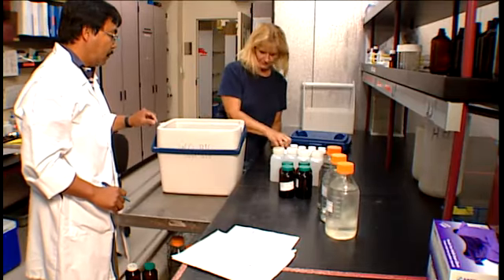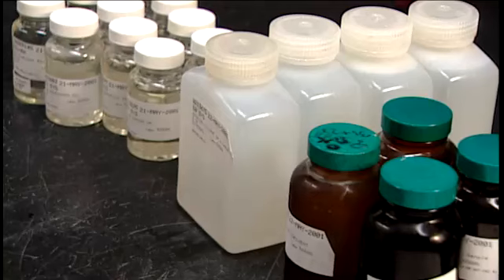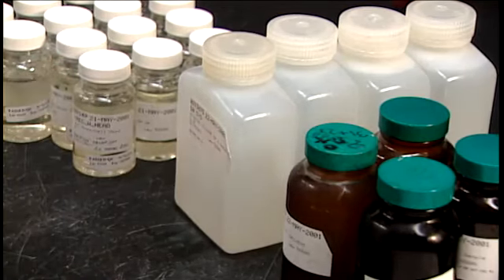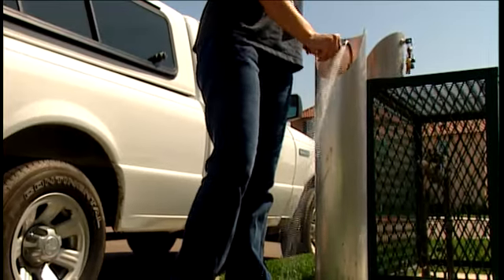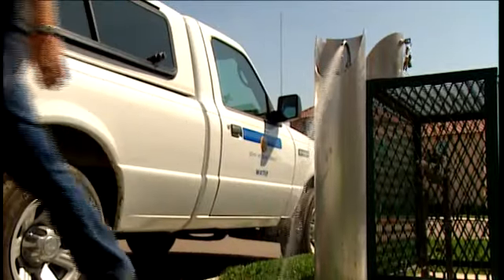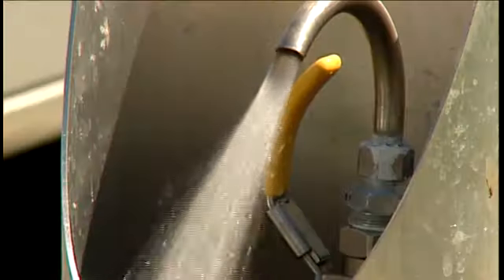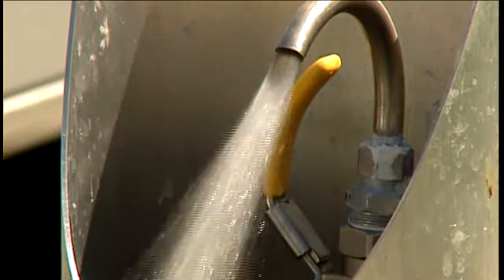Tracking and properly identifying sample containers are as important as the water sample itself. Sampling typically, but not always, calls for the tap to be flushed before the sample is taken. If this is the case, label the container while the tap is running as follows.